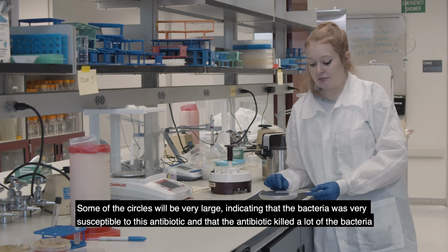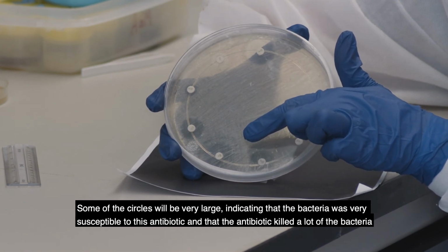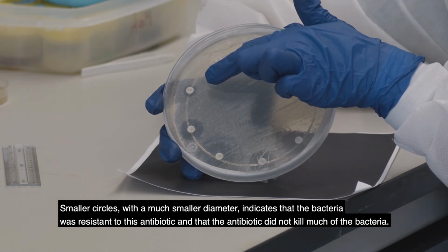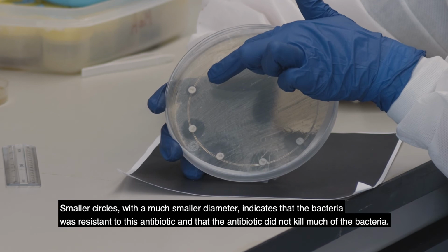So some of the circles will be very large, indicating that the bacteria was very susceptible to this antibiotic and that the antibiotic killed a lot of the bacteria, and smaller circles with a much smaller diameter, which indicate that the bacteria was resistant to this antibiotic and that the antibiotic did not kill much of the bacteria.